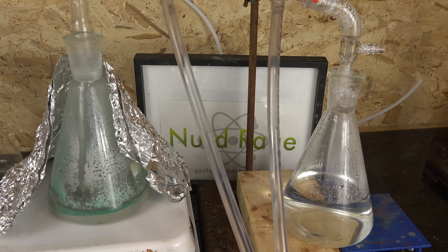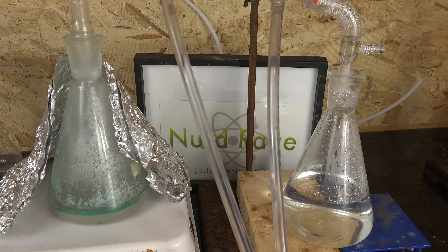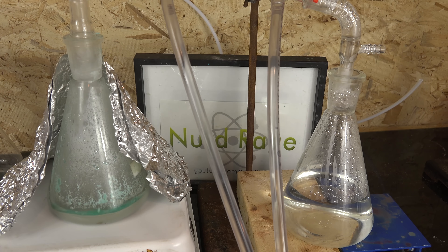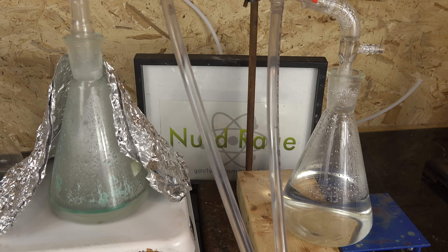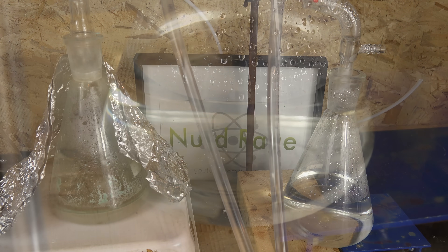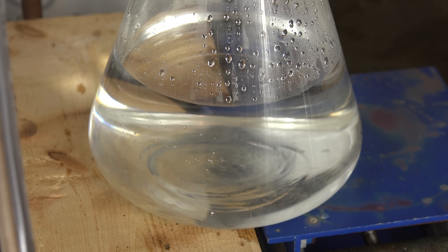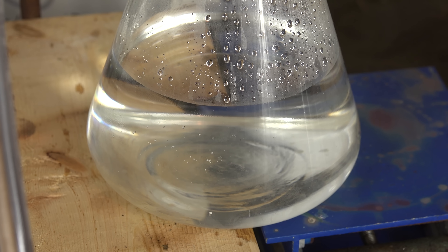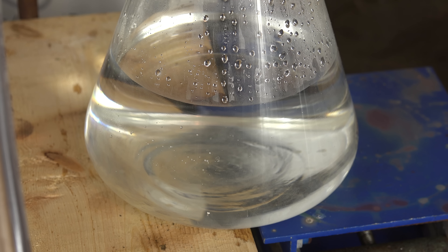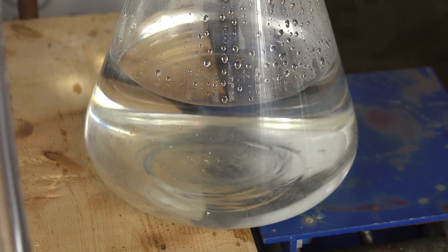Thank you viewers for letting me know. As you distill, the excess sulfuric acid will eventually start forming a mist in the boiling flask. At that point the nitric acid will have completely distilled over, so you can stop the distillation. And here is our distilled and dilute nitric acid. You can purify and concentrate it using fractional distillation as I've shown in a previous video, although I recommend accumulating a large quantity first to save on labor.